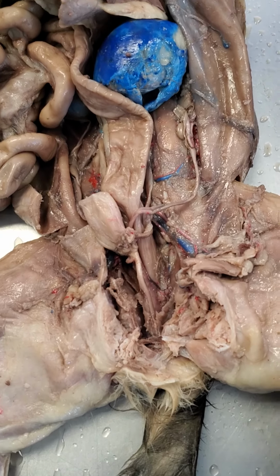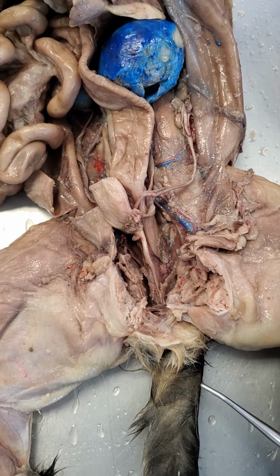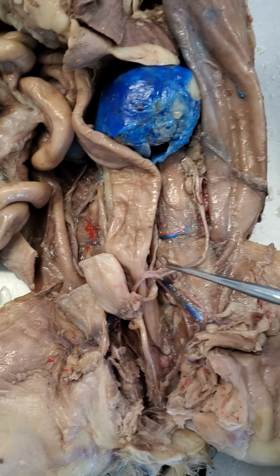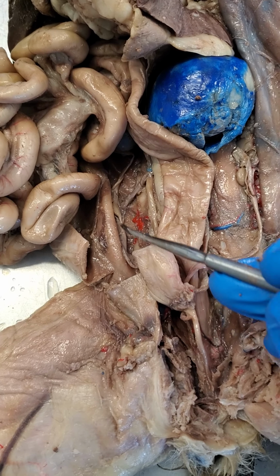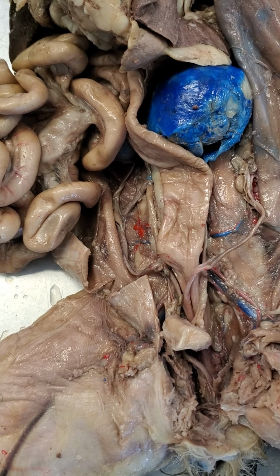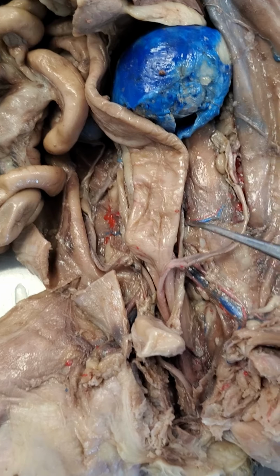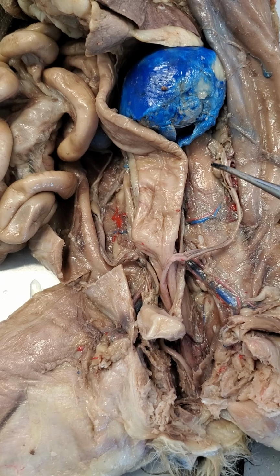All right, so the first one is if we're looking at the female, so if it isn't immediately obvious to you from external cues or structures, what we can do is once you open up the abdomen of the cat, you'll typically see in females these two horns or branches that are kind of sticking out. You can see another one's going into there. All right, so you can see these two branching structures that are sticking out. And if you look closely, you can see that there's a roughly ovoid structure at the end of them, all right? And so essentially what we're looking at is an extension of the uterus of the cat, and there's an ovary right there at the end.